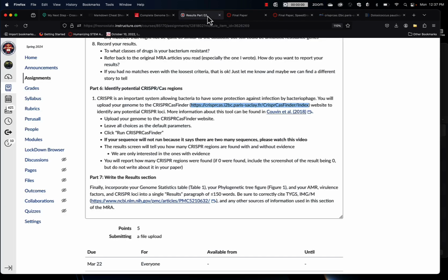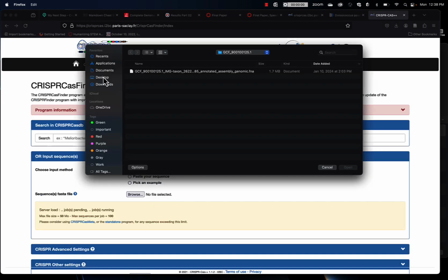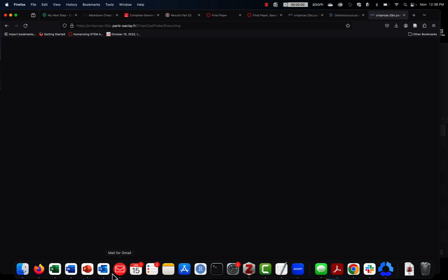And then basically what we would do is go to that website again, and we'll run the second part, which I had saved on my desktop. So part 2, open. I'll again put in my information. I'm going to call it part 2. And now I can run both. See, I didn't get an error that time either. So I'm running. And hopefully then I'll get my email whenever the run is done.